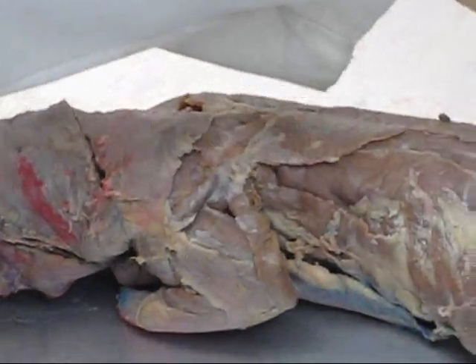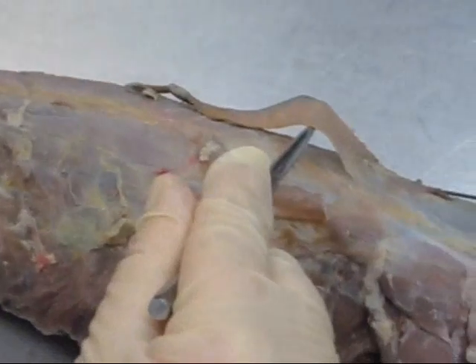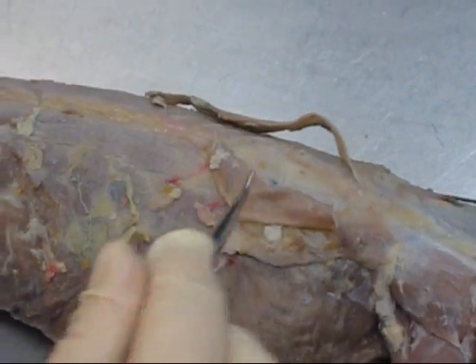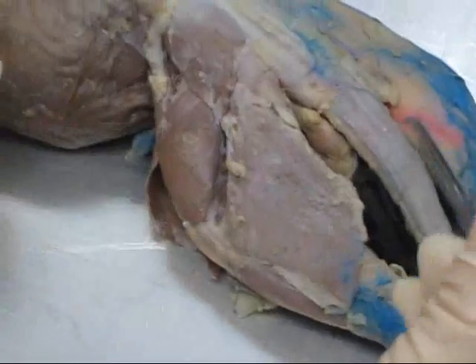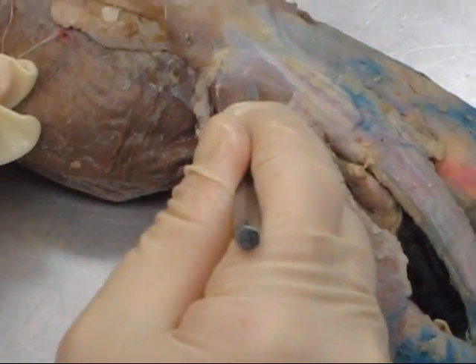Further down in the back we have our bacon muscle, better known as cutaneous maximus. The muscles we just saw today down here, near the mink's thigh — the posterior thigh — gluteus maximus.